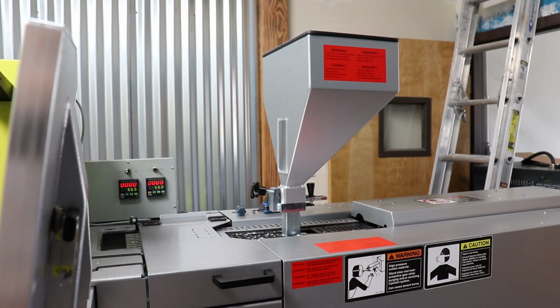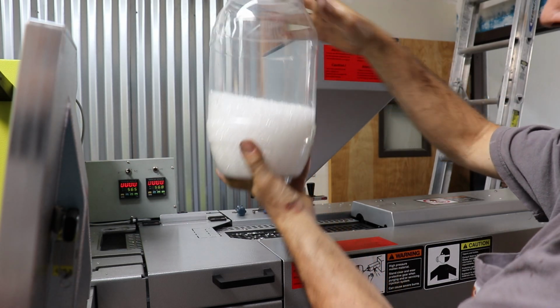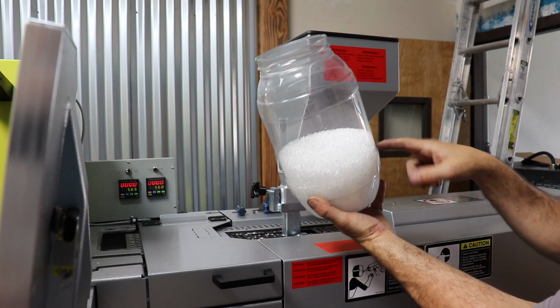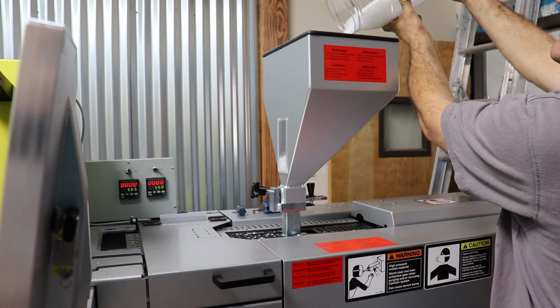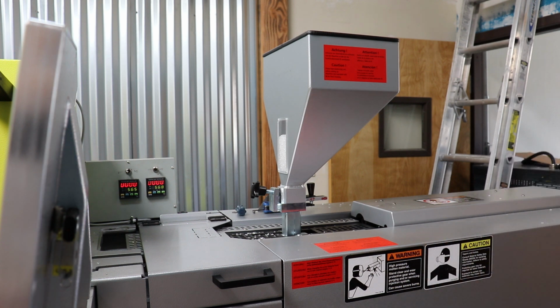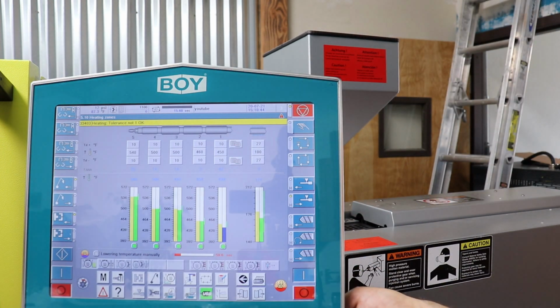All right, so one of the things we've got to do is purge out the old plastic that's in this molding machine. We're going to be using a COP plastic, which is this material right here. And currently I believe there's nylon in the molding machine. So this is actually sacrificial plastic because I don't know what the traceability of this grade is, but it's good to just clean out old plastic that's already in the system with new plastic. And this grade is close enough to what we're actually going to be molding where it's acceptable. I'm almost certain it's the right stuff, but I can't prove that it's the right stuff. So what we're going to do now is open up the gate. So we'll drop some plastic in.